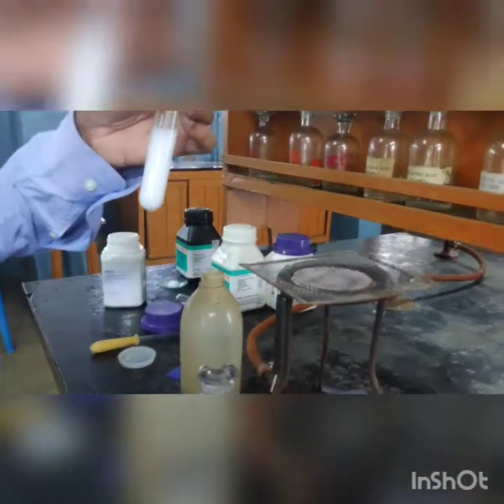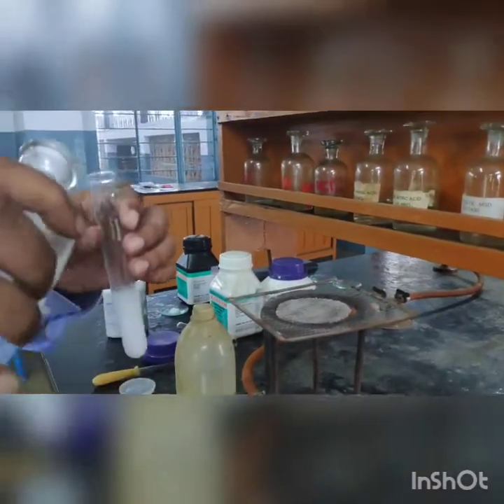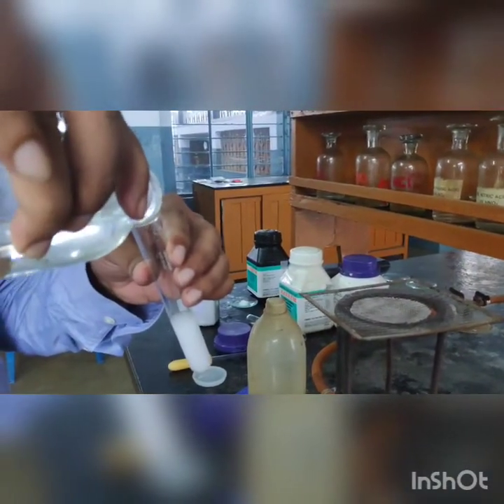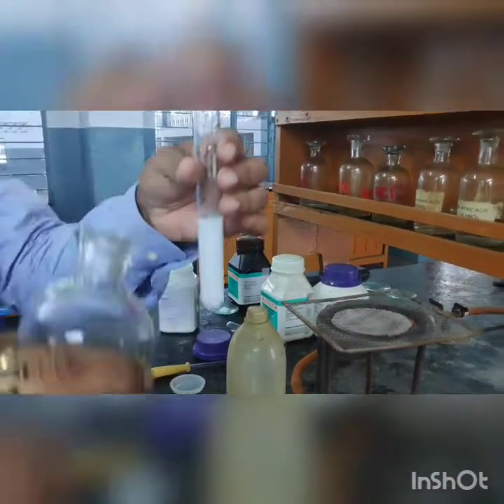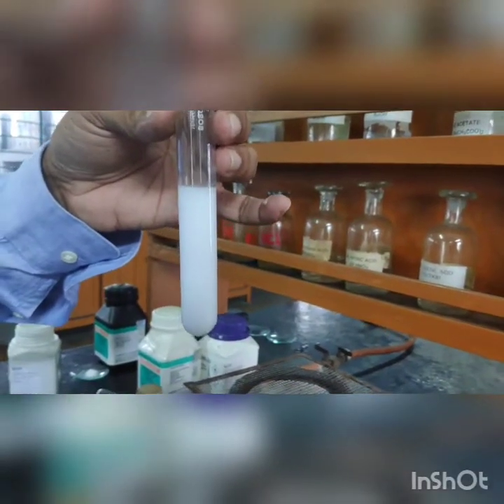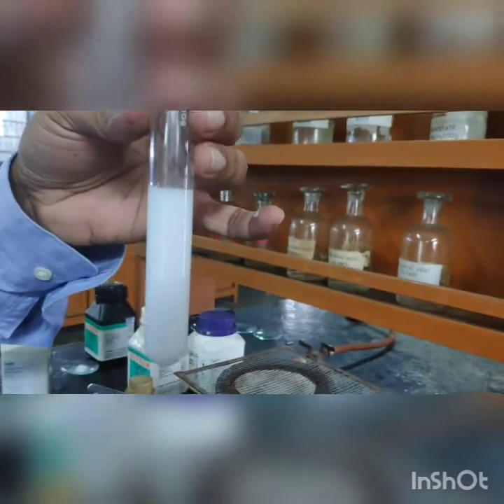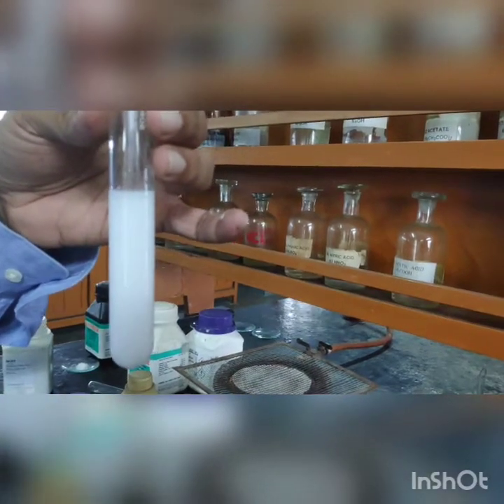Even after adding a little HCl, the precipitate is not soluble. We can now confirm that the salt taken to prepare the sodium carbonate extract contains the sulfate radical.